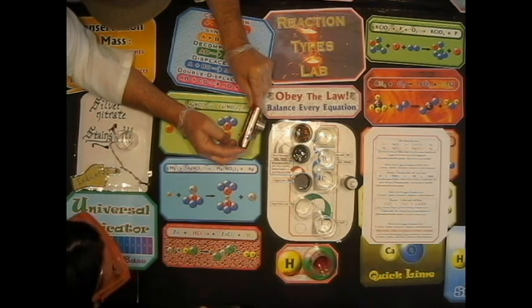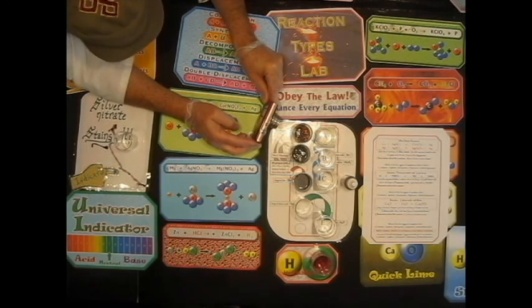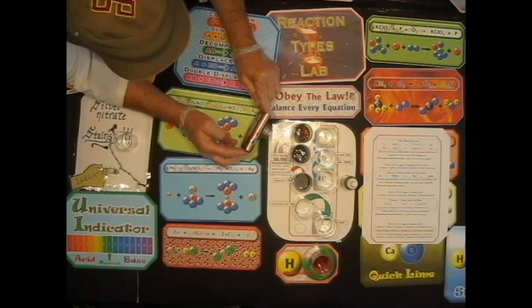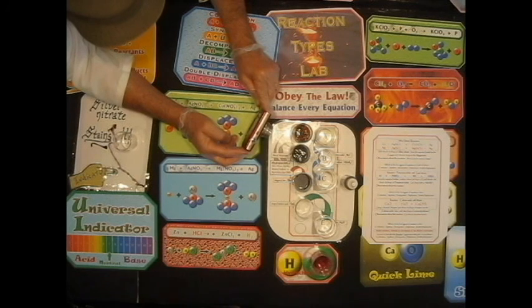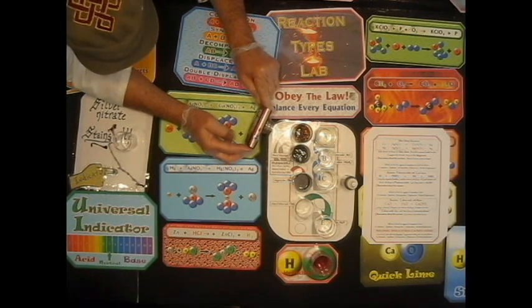Probably bubbling or changing color. Change in color. Yeah, because look at that. That doesn't look like copper anymore. Oh, it just started floating to the top. That doesn't look like magnesium anymore. So that means there must be some bubbles there to lift those things up to the top. The bubbles stick to them sometimes and elevate them.